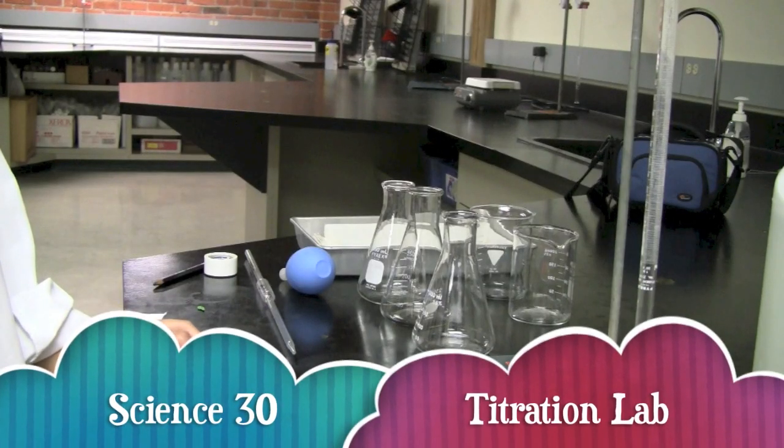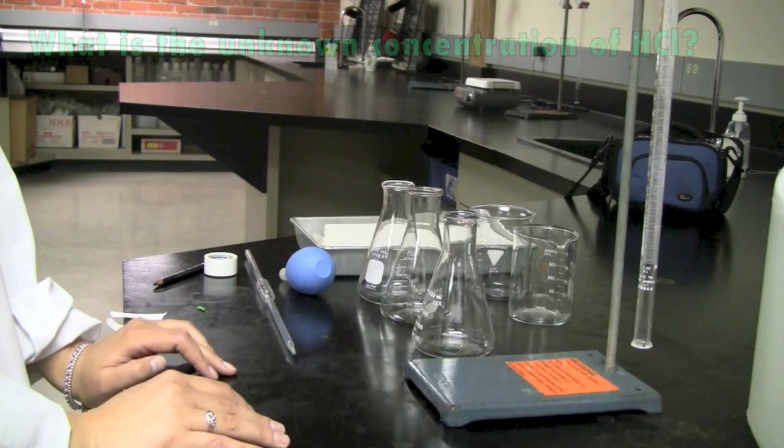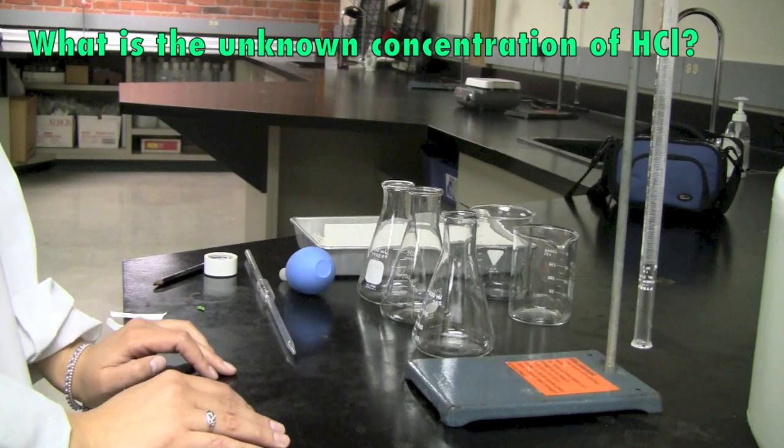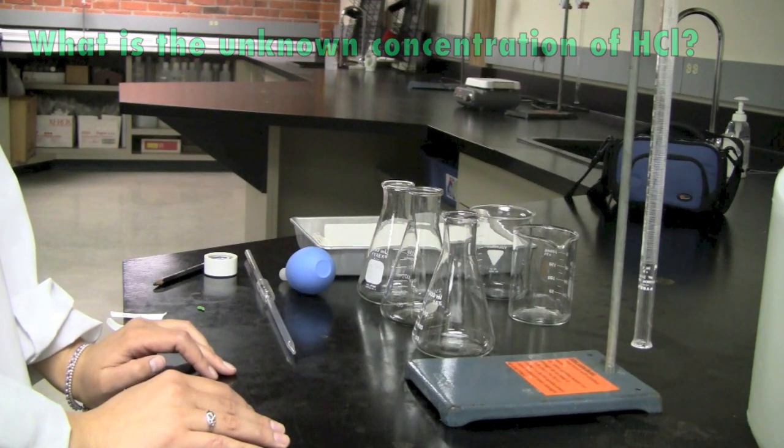So today we're going to do a lab on titrations. And the problem here is to figure out what the concentration of the hydrochloric acid.